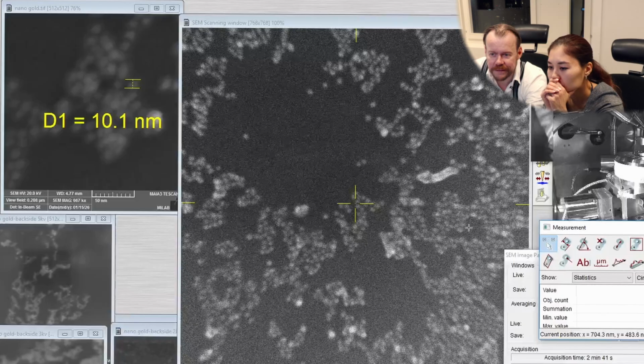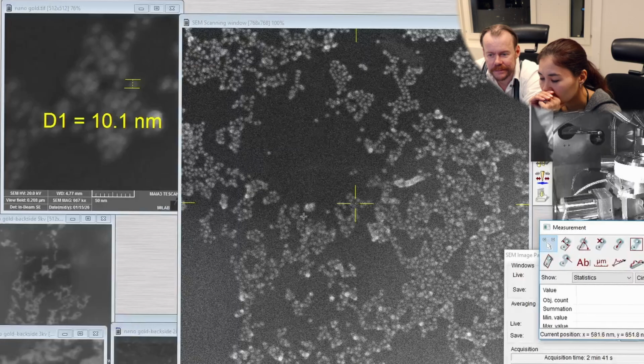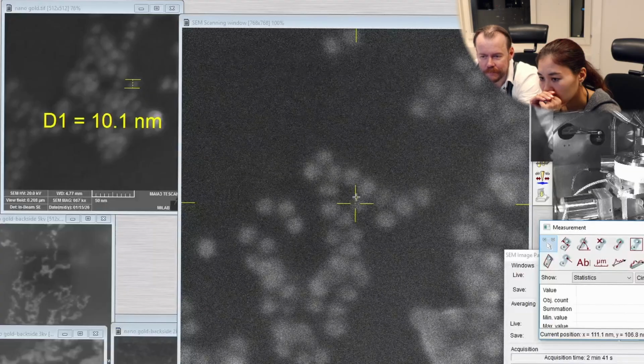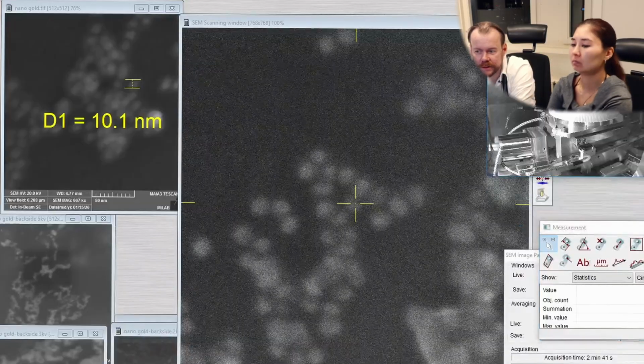Trying to figure out if we can see that old place. And since there's a mechanical motion on the stage, there is like 1 micrometer error in the motion of the stage. So since this is super high resolution, that is an obstacle, I'm wondering if we can see that. But we are in the same area at least. But let's see if we can improve this resolution on these particles.